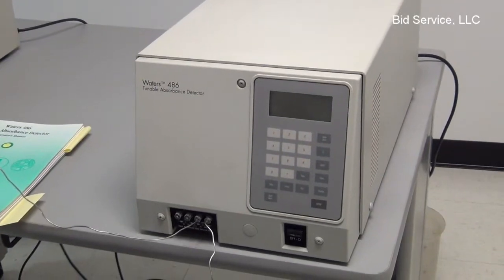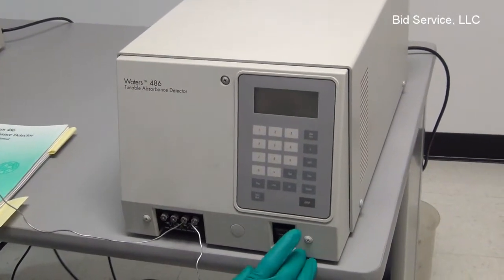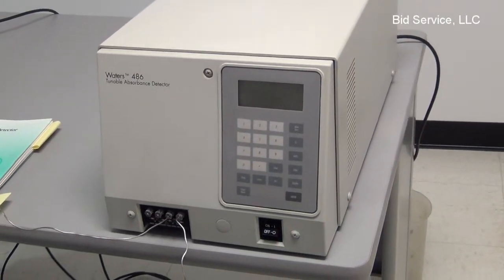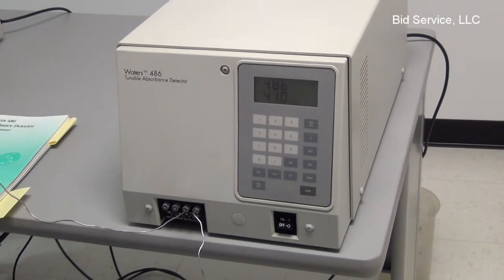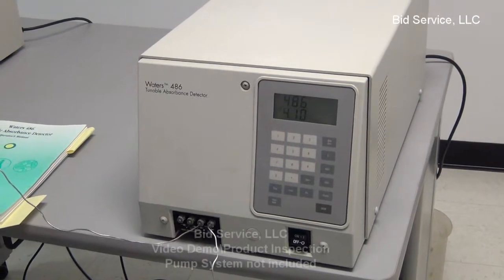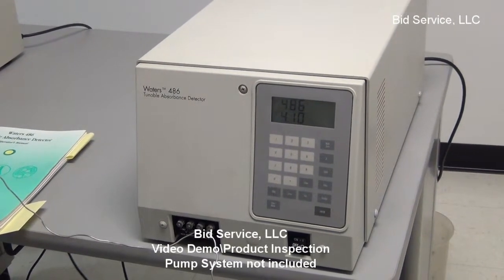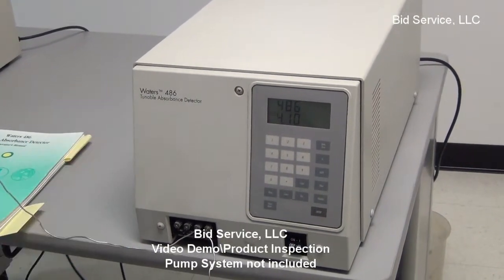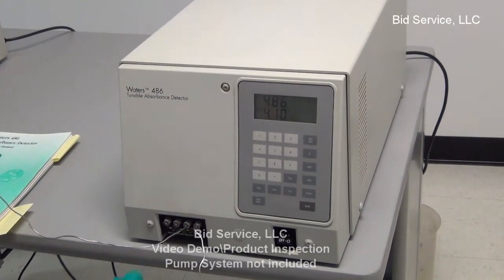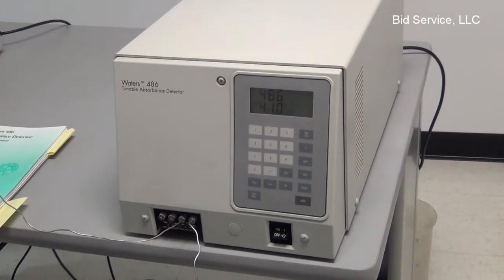This is a 486 tunable absorbance detector. The system is connected to a Waters 510 HPLC pump system. In order to simulate the working of the machine, the system needs sample lines to be hooked up.